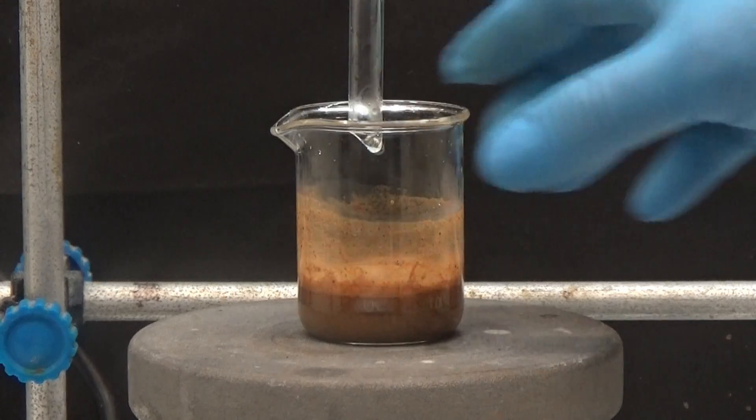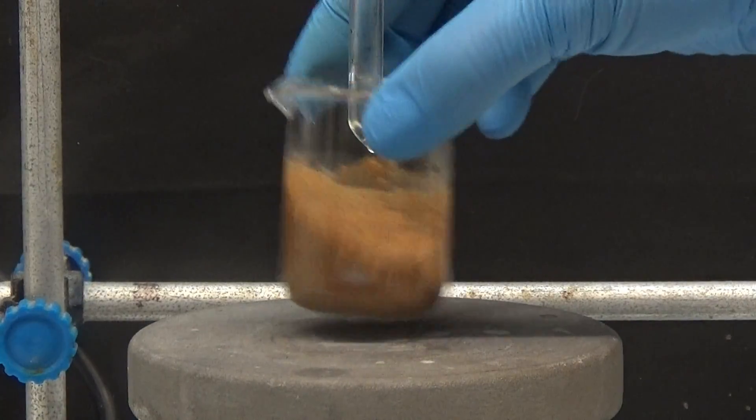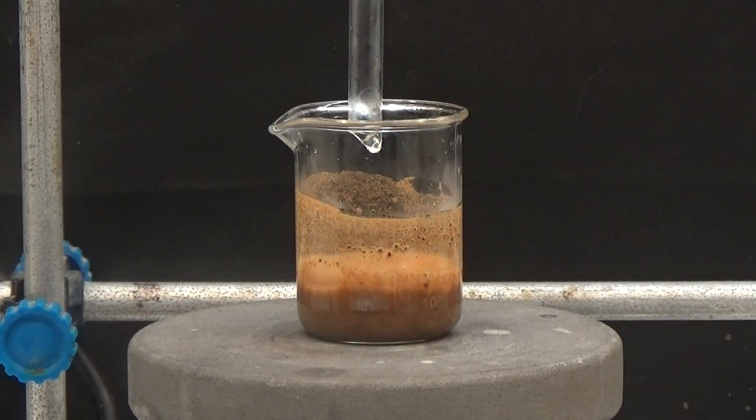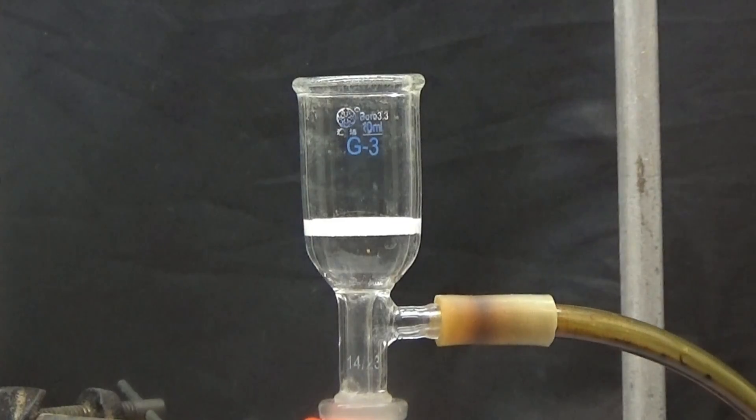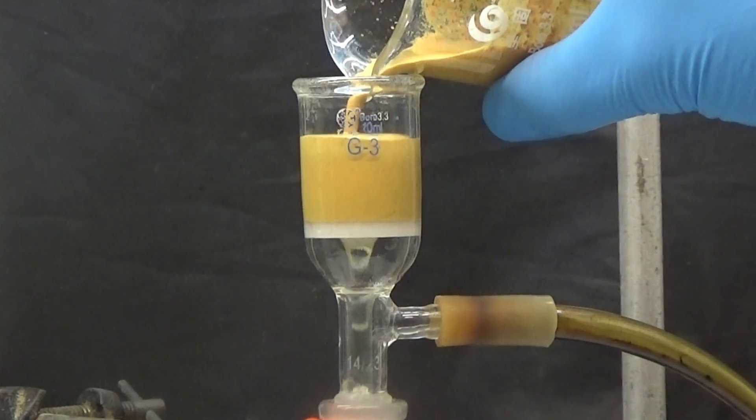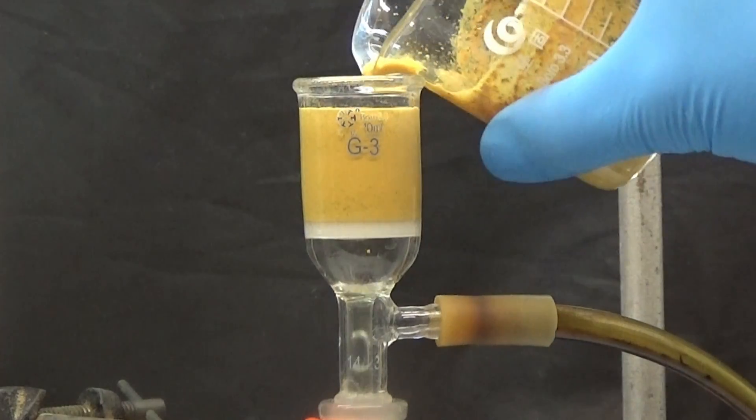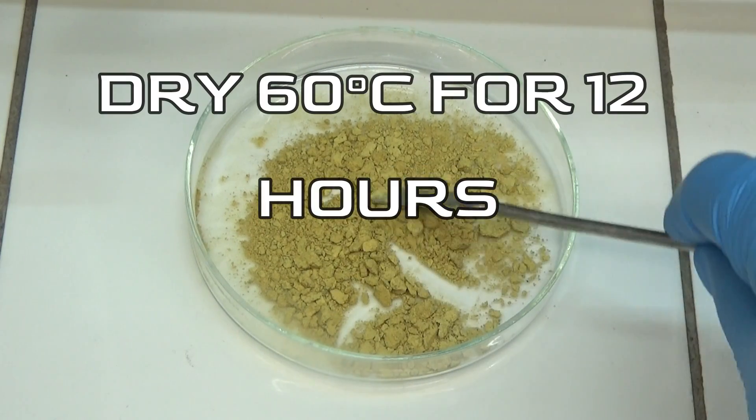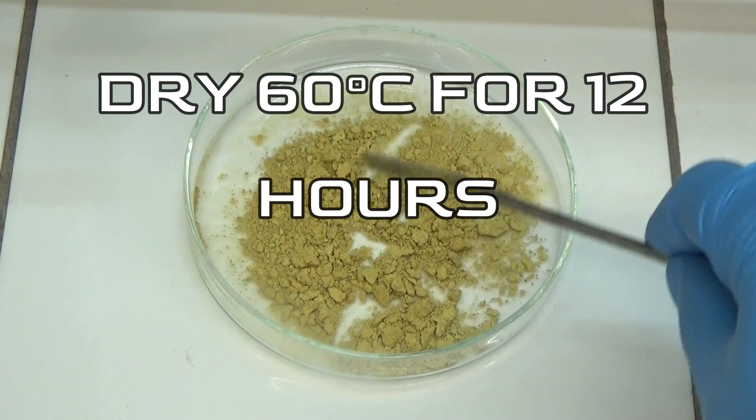Over a 20-minute period, the nitrite solution was added. Once all the nitrite is added, the solution turns orange. We let it stir for 2 hours at room temperature, and the solid turns yellow. Collect the yellow solid by suction and wash it with a little cold water. Allow to dry in an oven at 60 degrees for 12 hours.